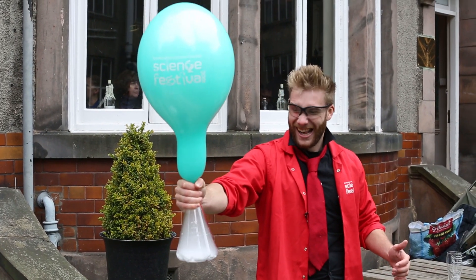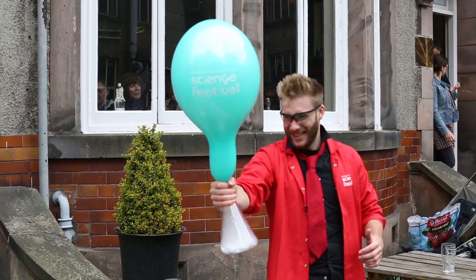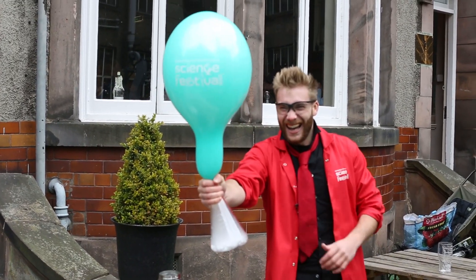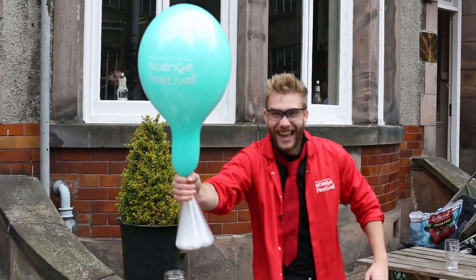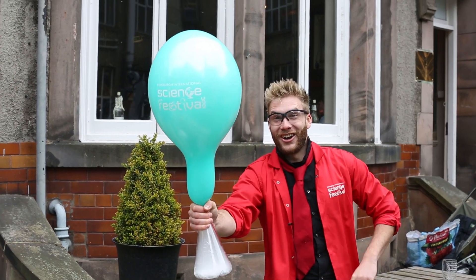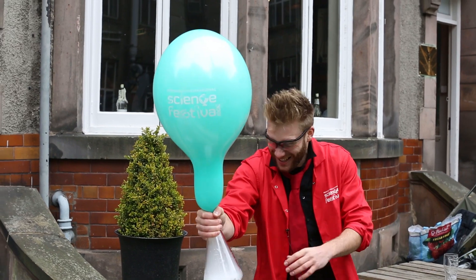It's going to go. I can't even hold on tight now. It's going — I can feel it. It's just incredible quite how much you can get in one of these things.